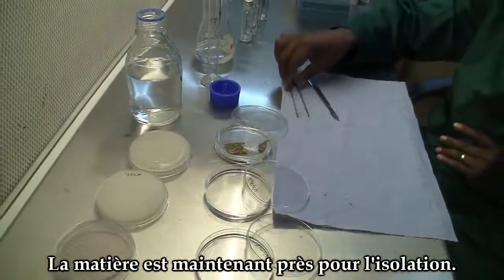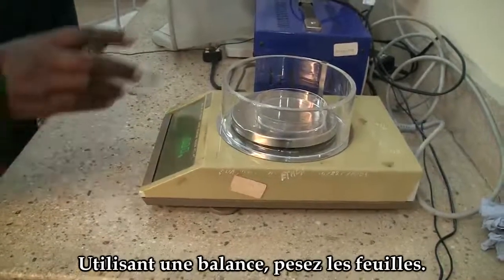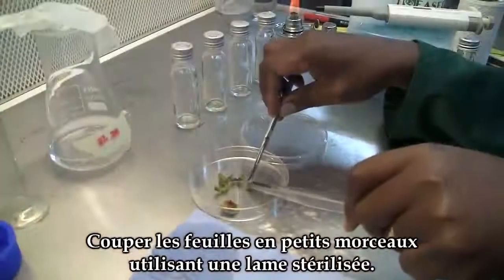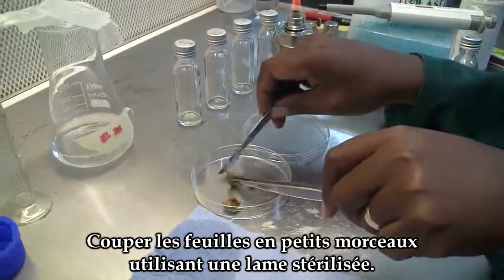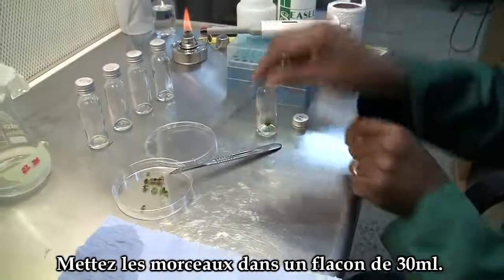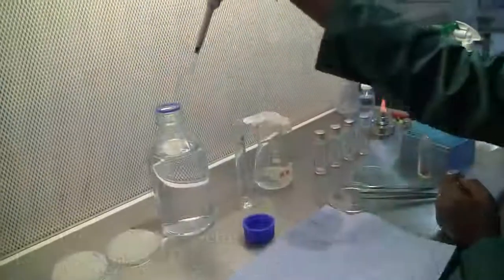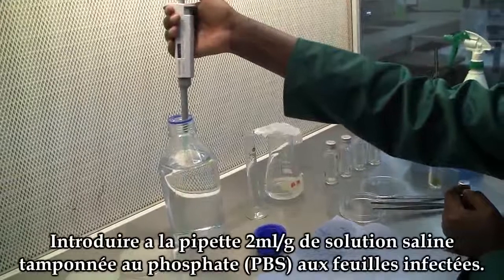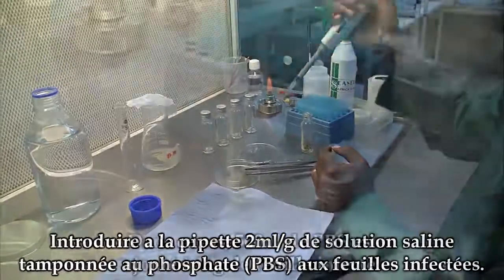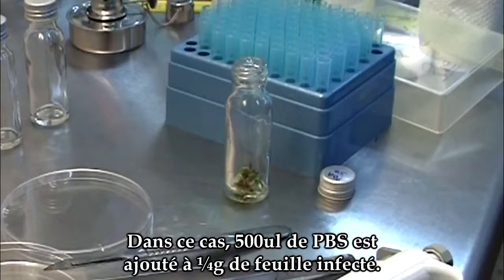The material is now ready for isolation. Using a light scale, weigh the cut leaf material. Cut the leaf material into smaller pieces using a sterilized blade. Place the cut pieces of leaf material into a bottle. Using sterilized phosphate buffer, add to the leaf material at a rate of 2 ml per gram. In this case, we have added 500 microliters to a quarter gram of the material.